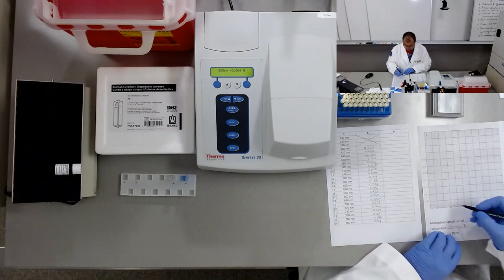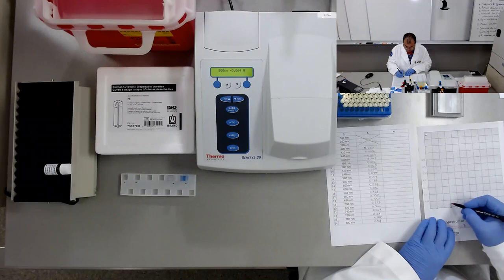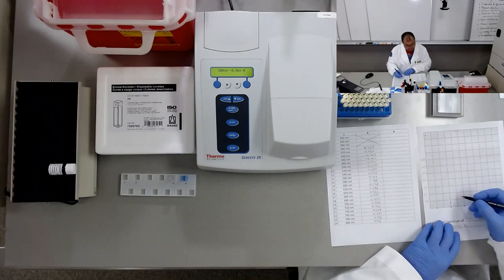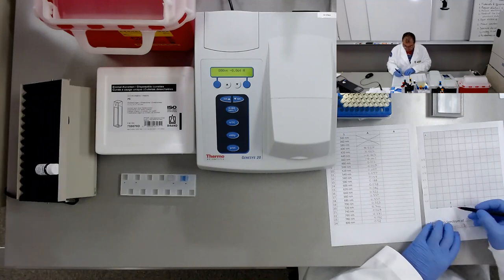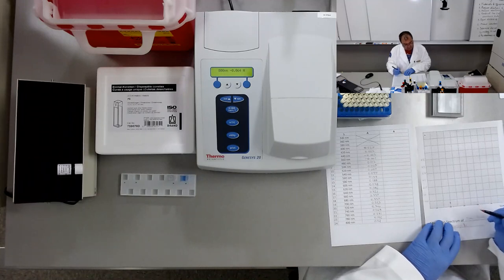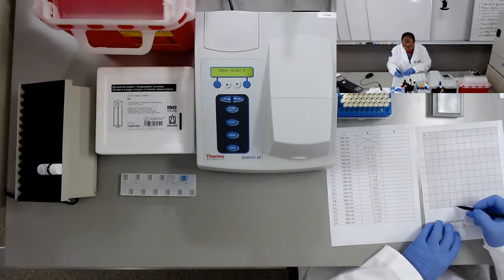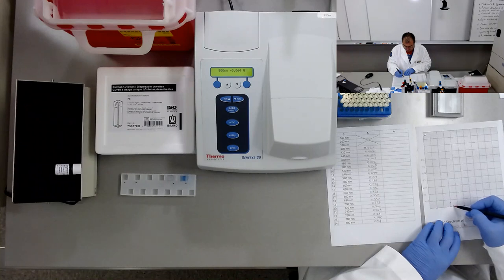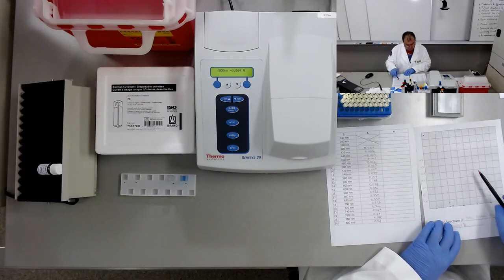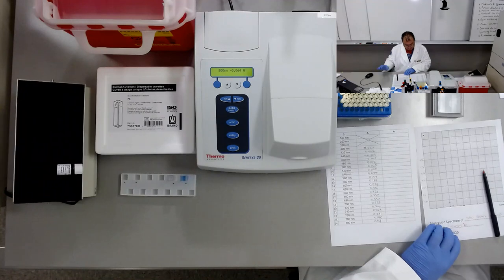The first value, 0.027, is about here. This is the first point. And we'll continue with the next, 420, at 0.002. Oh, it goes down, like that, and we'll keep going, placing the points for all of these sets of measurements.